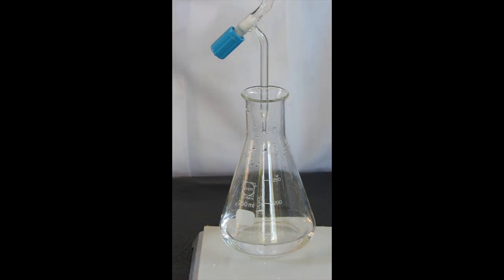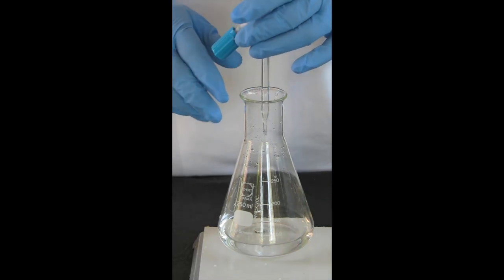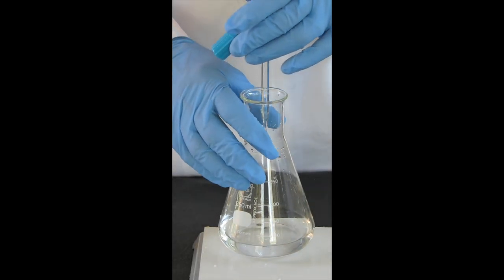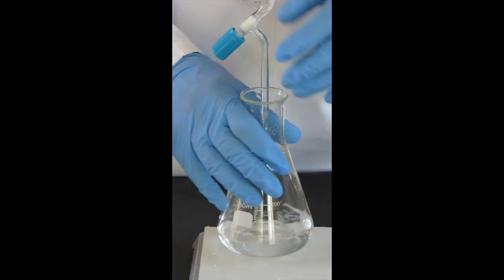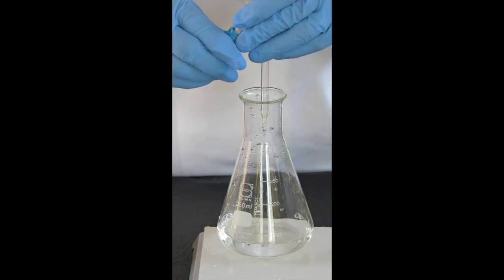I'm going to take a reading of my burette again. Make sure the eyes are level, and this time I have 19.64. If you're not sure that you've reached the endpoint, do a little rinse with just water and add another tiny bit.